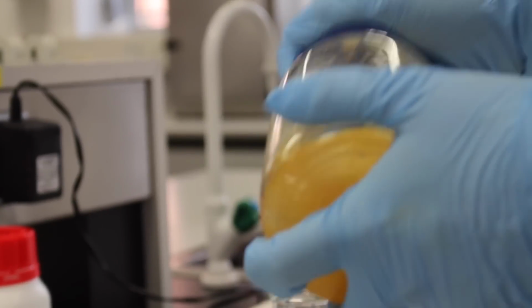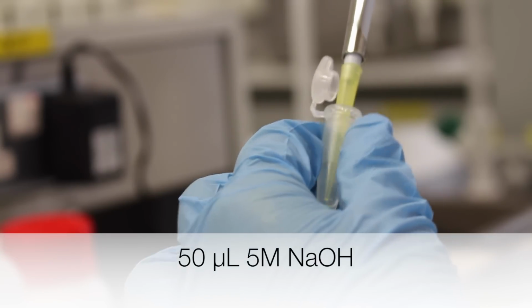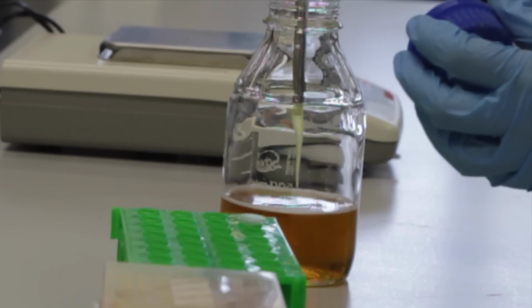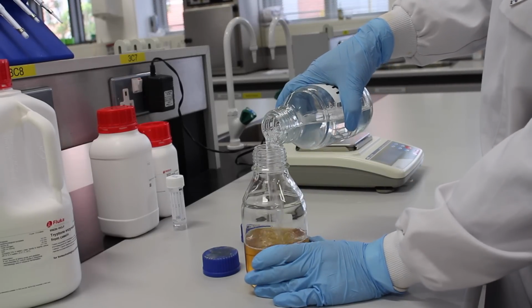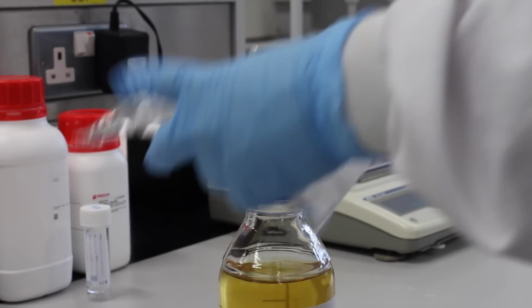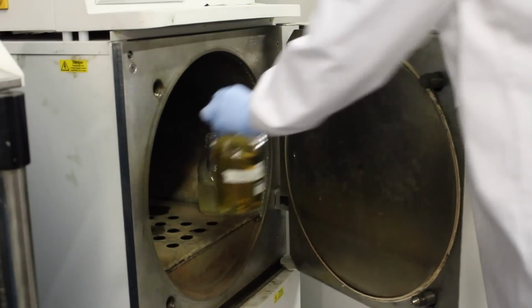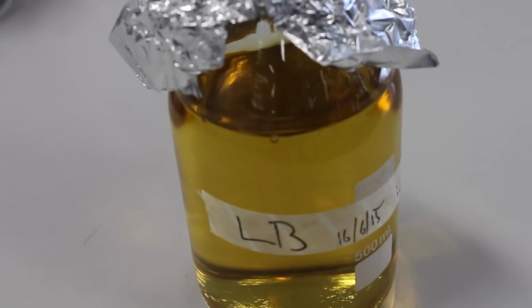Water is added to the bottle containing the salts. The glass bottle is shaken to allow the salts to dissolve. The pH is adjusted with 50 microliters of previously prepared 5 molar sodium hydroxide solution. Water is added to make up a final volume of 500 milliliters. The cap on the bottle is loosely closed. The top is then loosely covered with aluminium foil. The solution is autoclaved for 20 minutes. LB solution can be stored at room temperature.